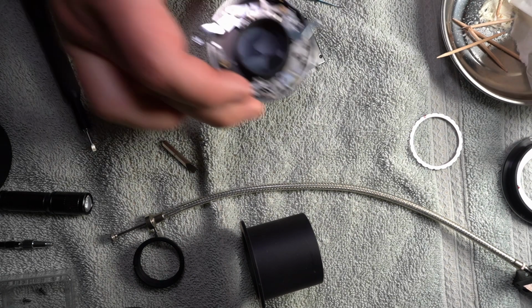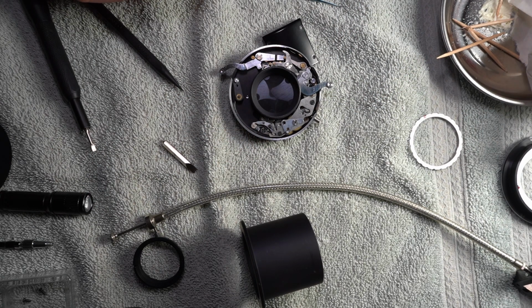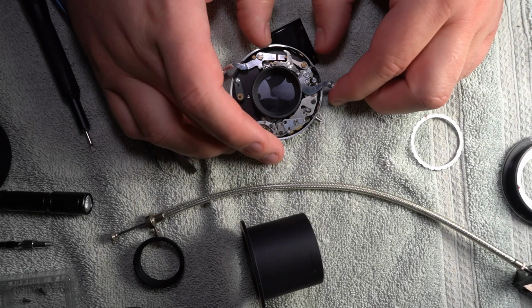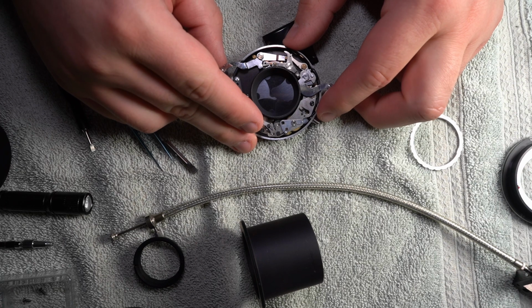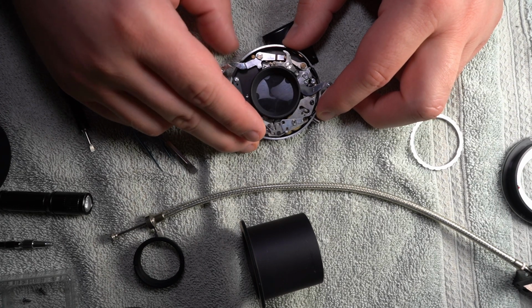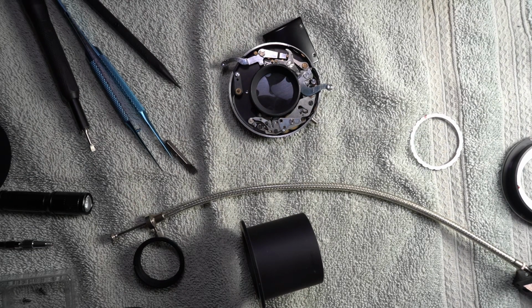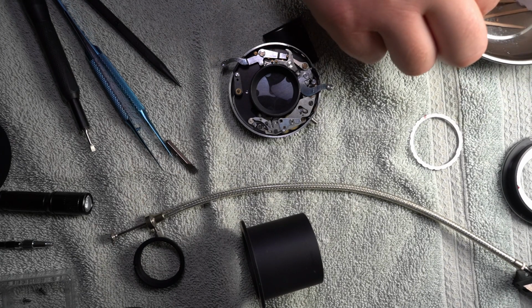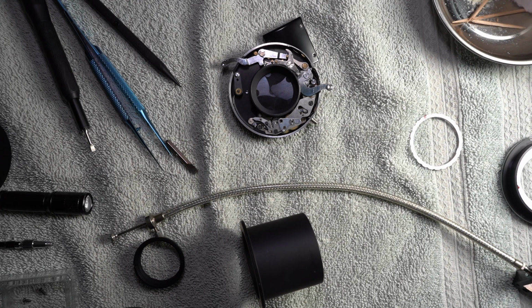Now let's see if it works. Because that's the real trick, you know, after you fix it, does it actually work? That's a big question at this point. It should. I mean, I didn't really do anything to it that should have affected that. This is a lot smoother, I can tell you that. I don't know if that is, but I assume I greased it. It should be. I'm gonna actually put a little bit more on there.